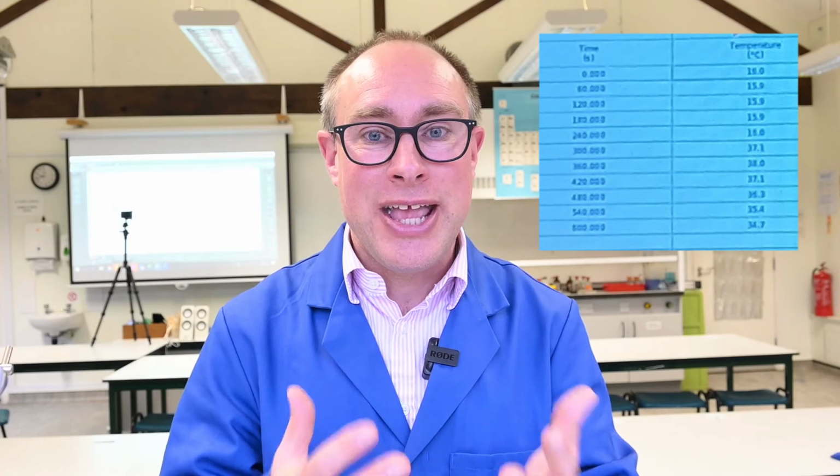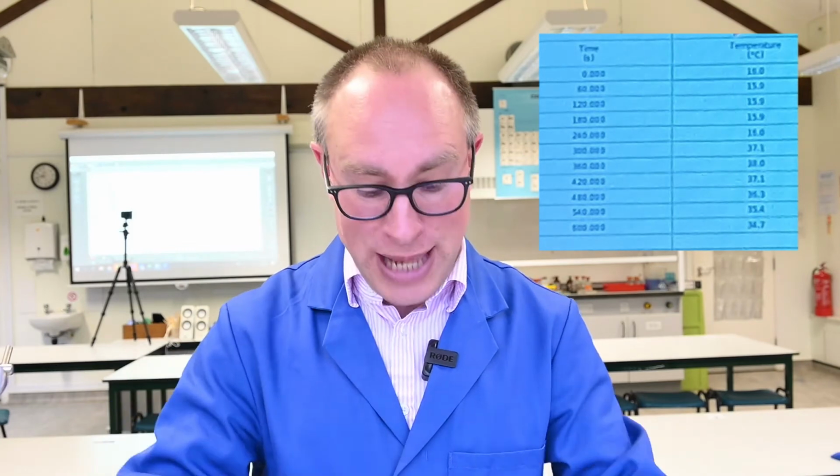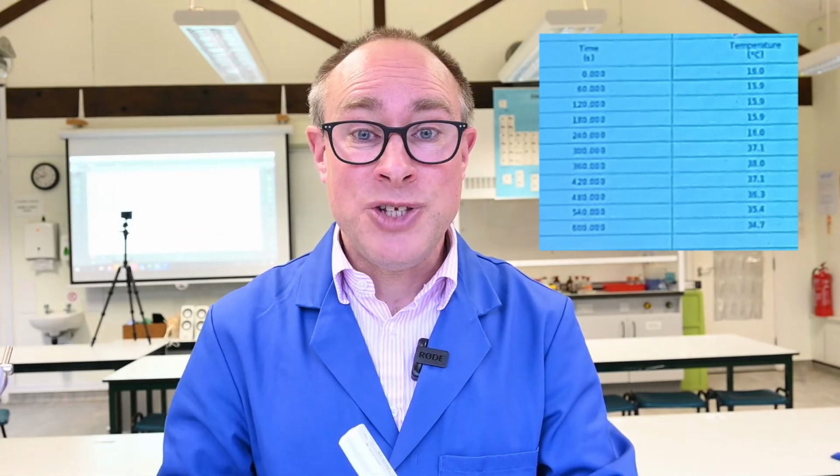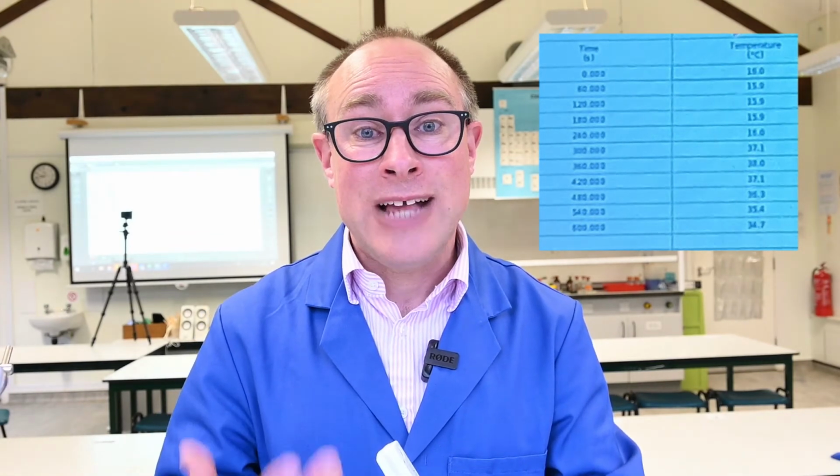And what I'm going to do next is to plot a graph of the results in order to be able to calculate the temperature change, the maximum temperature change that we would have had if all of the heat had been transferred to the water immediately. Water takes a little while to heat up, and so therefore it will be losing heat all the time that it is warming up out through the surface of the beaker, etc. I'm just going to filter off this mixture, and then I'm going to plot a graph and analyse the results of this experiment.